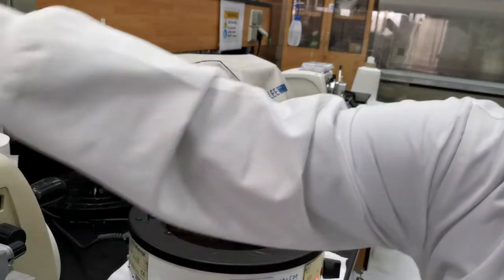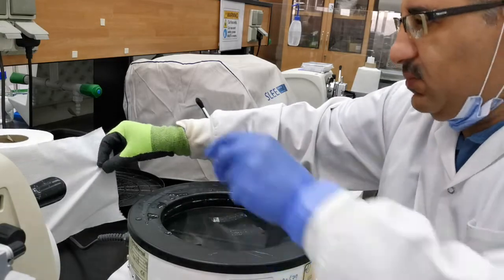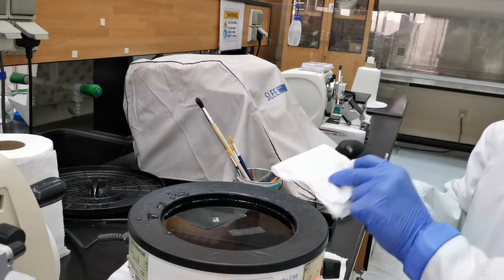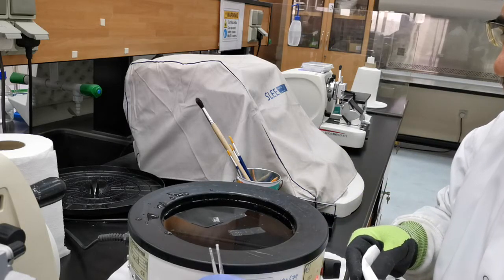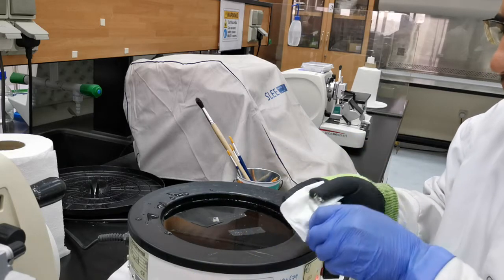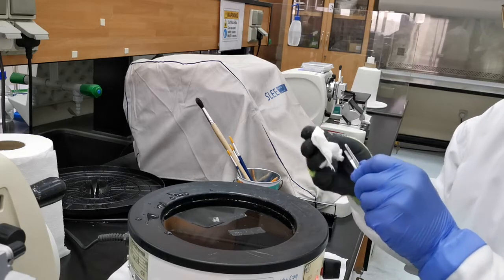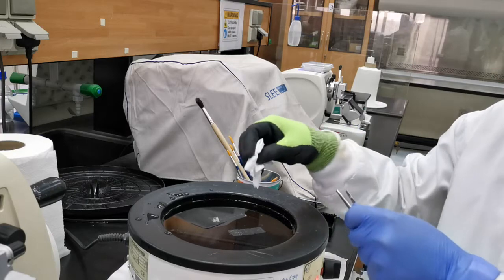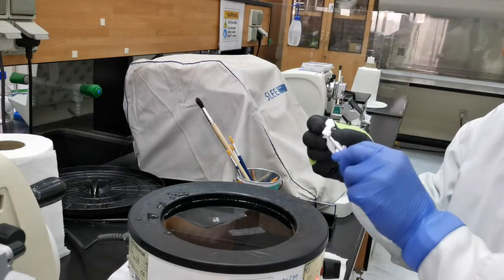What's the best thing to clean the paraffin? Xylene. So use xylene — just some drops here — and clean the edges of the tweezer. You don't want any paraffin traces, otherwise they will stick to the tissues, take the tissue with them, and ruin it.